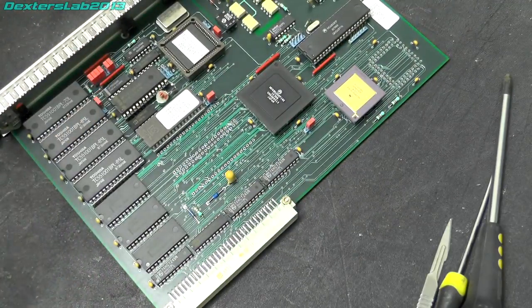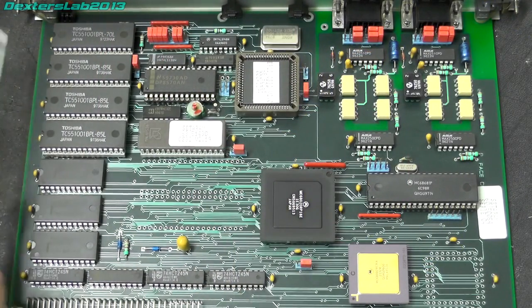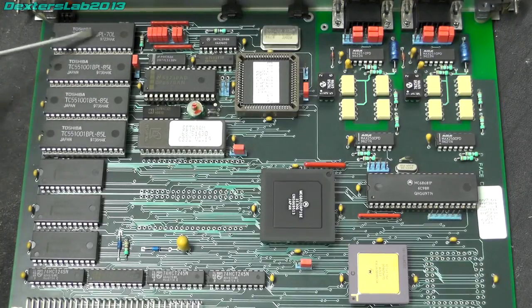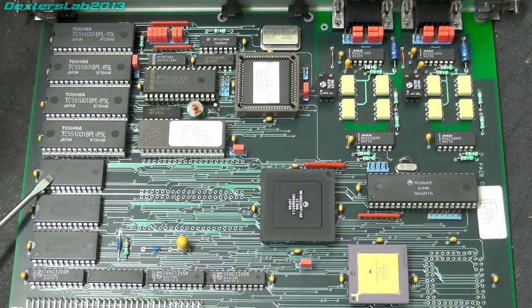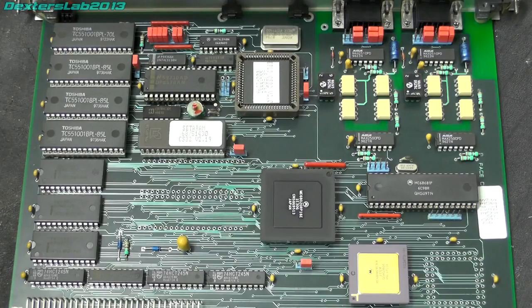Right, let's have a look at this CPU board. Right, let's have a quick look around. So over this side we have some Toshiba TC55-1001. Those are 128K SRAMs, so we've got four of those, so we've got half a megabyte of RAM. And then just below these we have some Intel P82C542s, which according to the datasheet are a programmable interval timer. High performance CHMOS version of the industry standard 8254 counter timer, which is designed to solve timing control problems common in microcomputer system design. Three independent 16-bit counters, capable of handling clock inputs up to 10 megahertz. Software programmable. So we've got three counter timer things there.